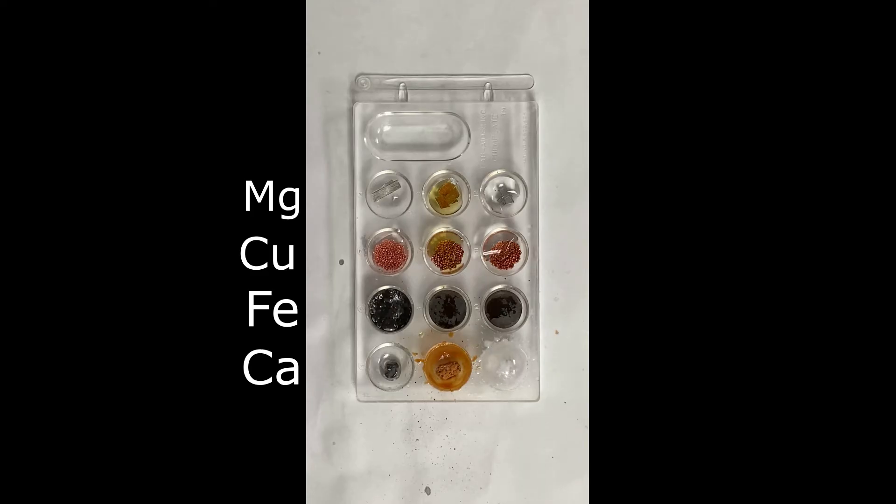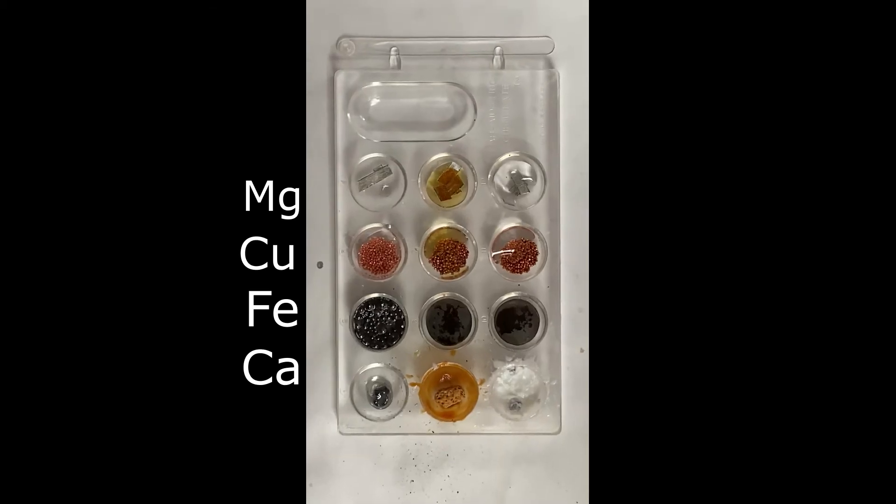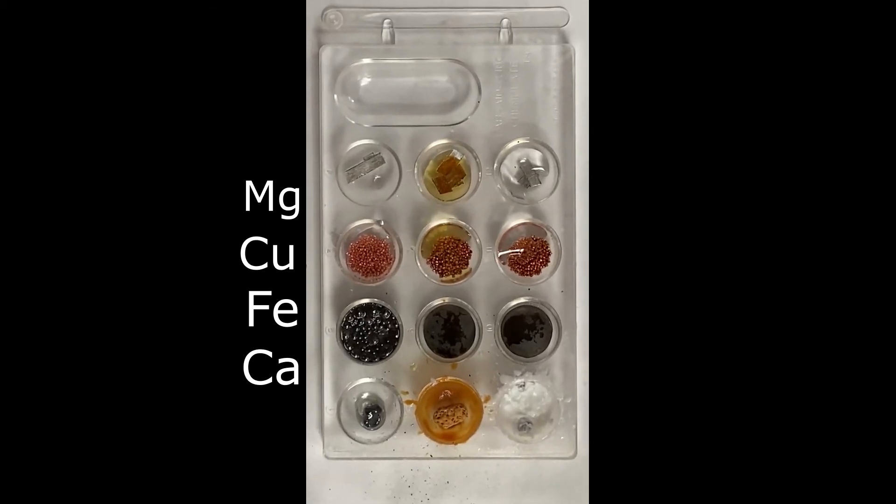All right, I'm going to go ahead and give you a close-up of what this final product looks like so you can see it up close, which wells have truly reacted and which ones haven't, especially the ones that reacted late. Here you go.